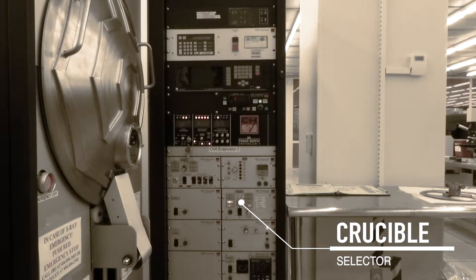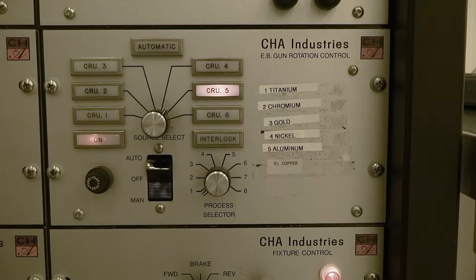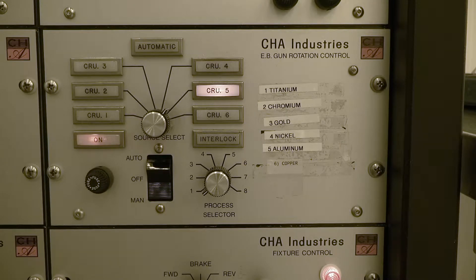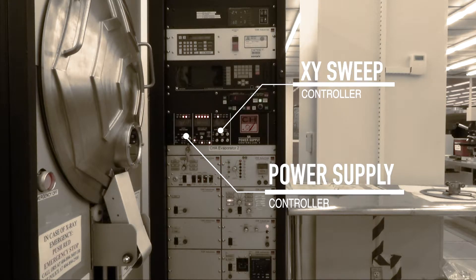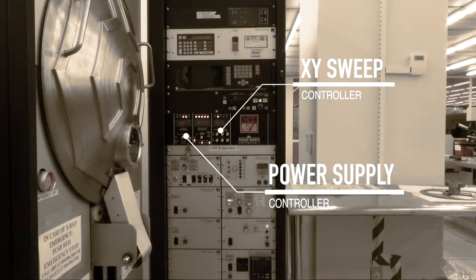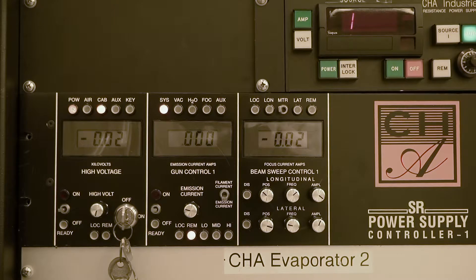The crucible selector moves the selected crucible into position for evaporation. The power supply controller controls the electron beam power supply. The XY sweep controller controls the position of the electron beam.